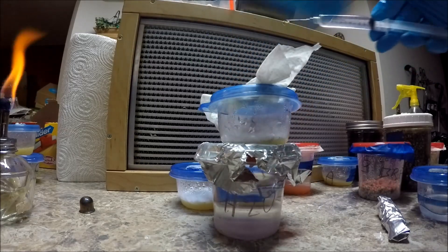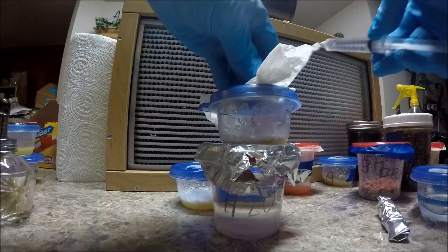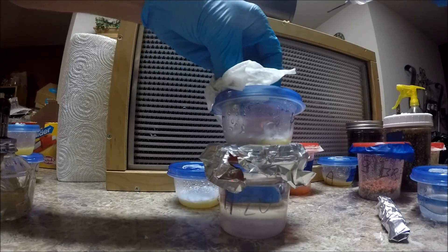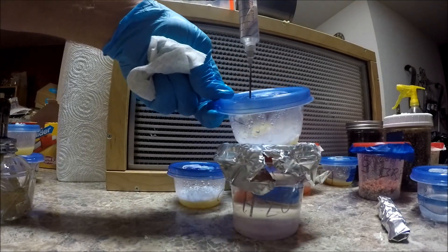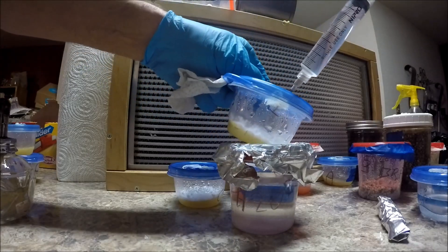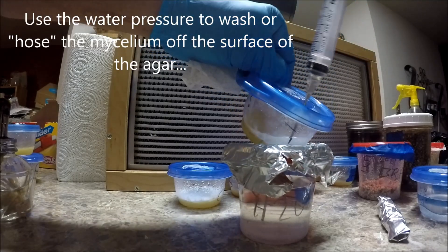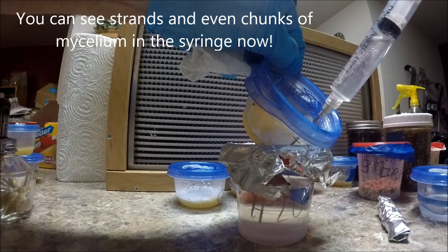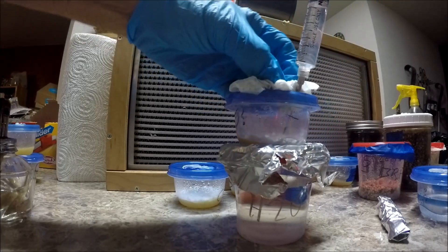Now, this is really what I want you to see. I'm going to risk my sterility for you people. And this is the money shot here — this is what it all came from. We're going to wipe that off. The needle will hopefully still be sterile going through that silicone. It went in pretty well. And then that white magic — we're going to hose that right off the agar, and then we're going to suck it back out, nice and slowly. If you put 10 in, I'd only expect to get maybe 8 out — it's never going to work out right.